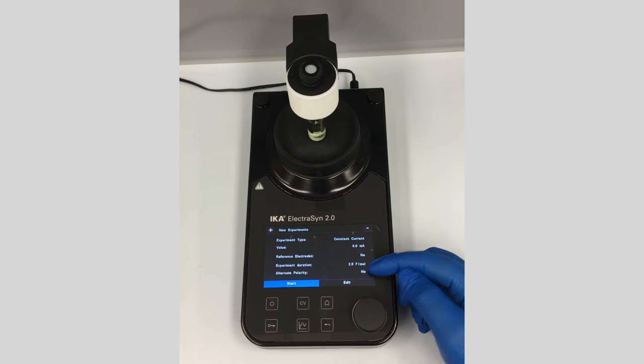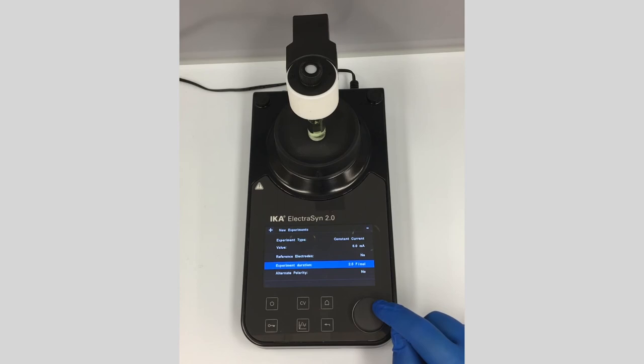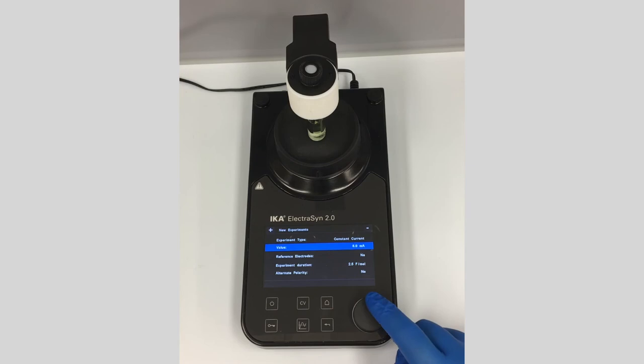If you want to edit the parameters, click the edit button and scroll down to adjust any of the values. For example, you can adjust the current down a bit or back up if needed. We're not going to adjust anything now — just going to run it.